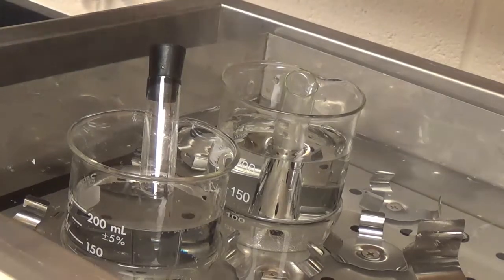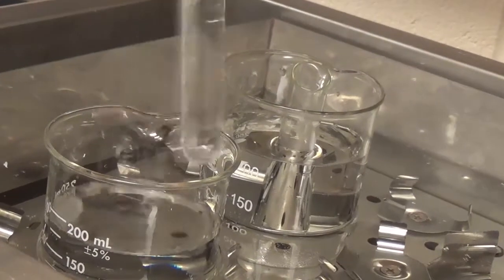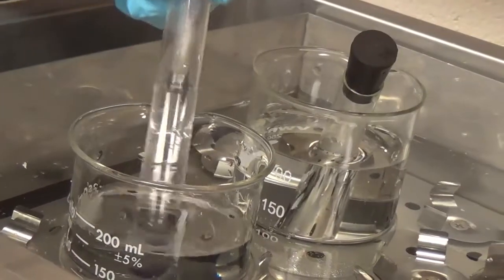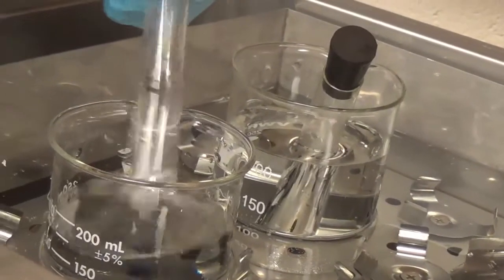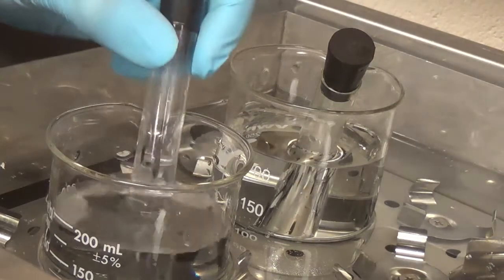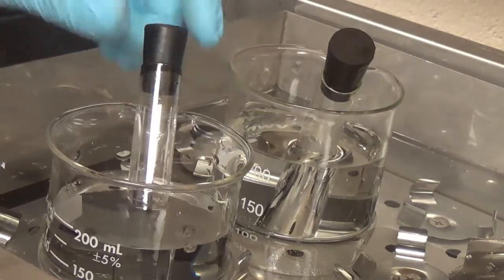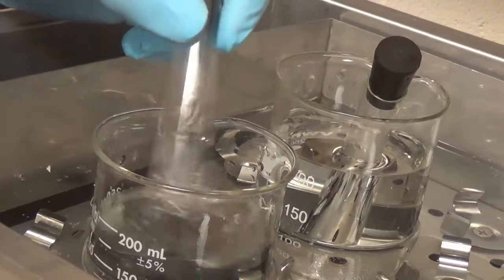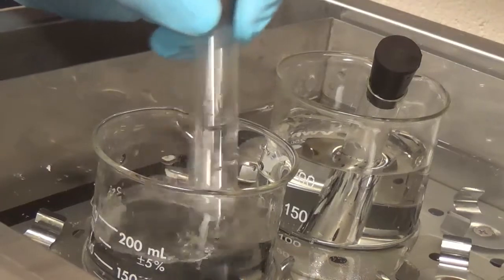This should be at a higher temperature. Do a little bit more of a shaky thing. So it's starting to come up. Let's go here. So I see a blue coming up. I'm going to just shake it up a little bit more.